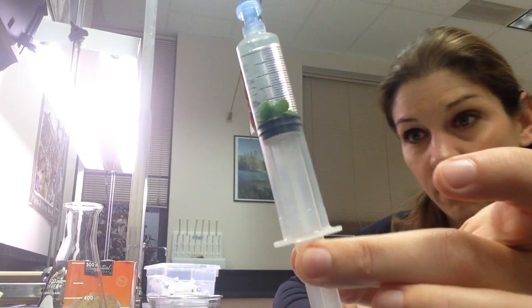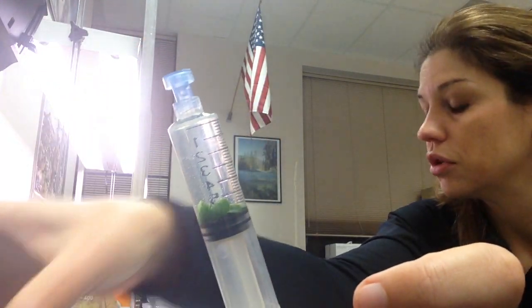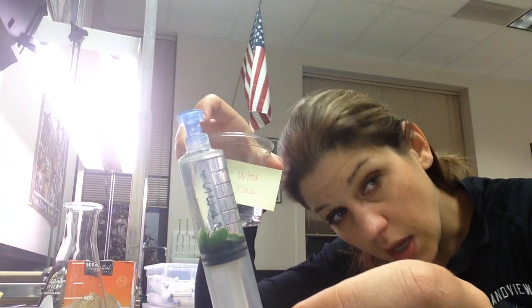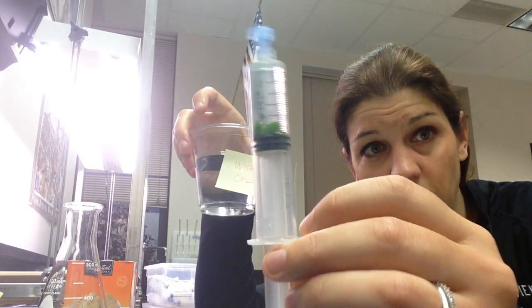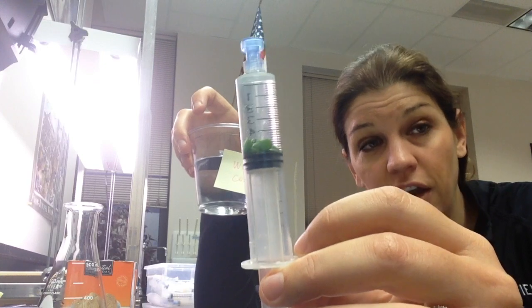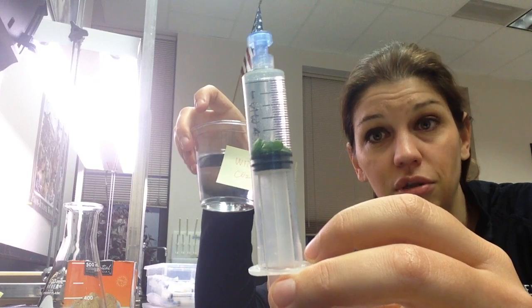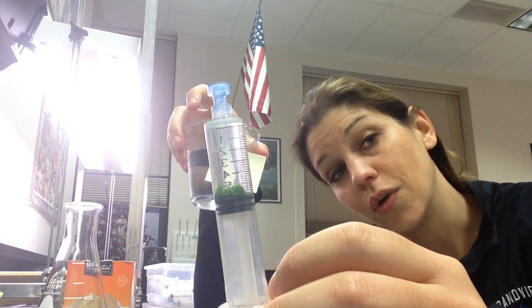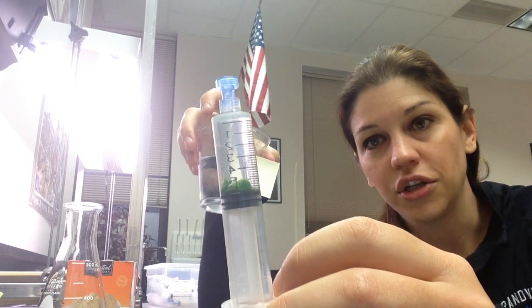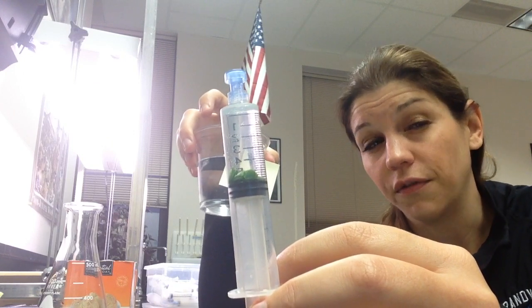I'm now ready to pour this back into my with-CO2 cup and expose it to the light I want to test. You want to do this pretty quickly because as long as these discs are exposed to light they are photosynthesizing. At this moment they're taking the CO2 and turning it into oxygen gas. The oxygen gas — just like with the enzyme discs — is going to cause the discs to float, so we can measure the rate of photosynthesis by seeing how long it takes the discs to float.